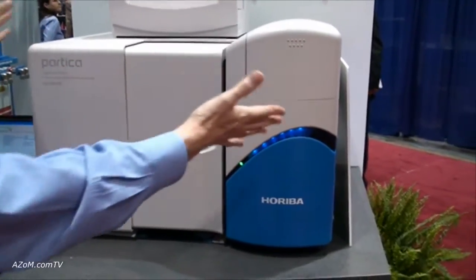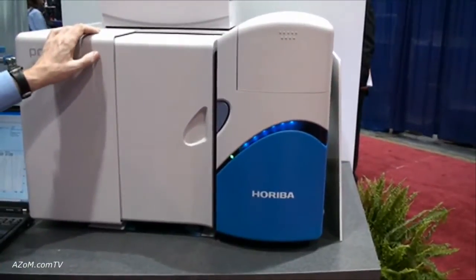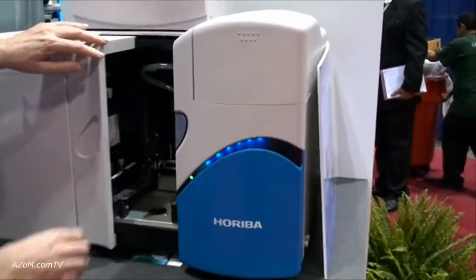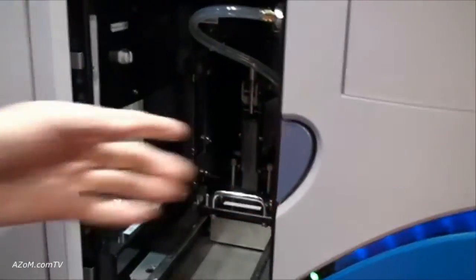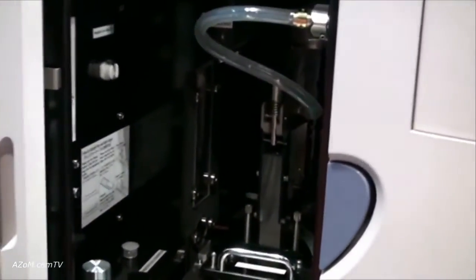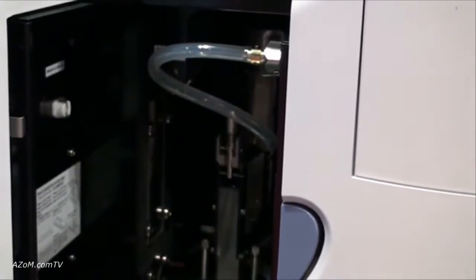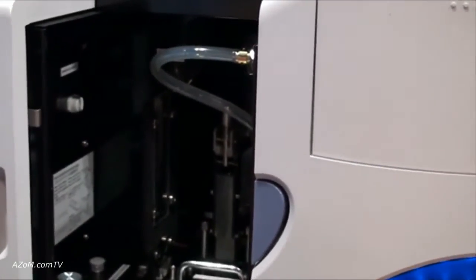The first thing you'll see is the optical bench. Inside there are optics where we have two light sources. Laser diffraction works by having a cell in here — as the particles pass through this cell, we look at the light scattered by the particles using two different wavelengths of light, a red and a blue light source. By looking at the angular intensity and the scattering of that light, we can calculate the particle size distribution.